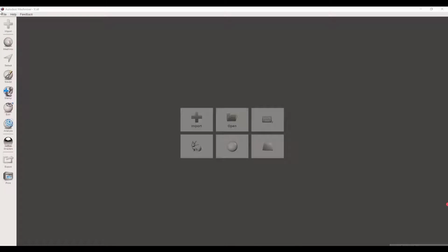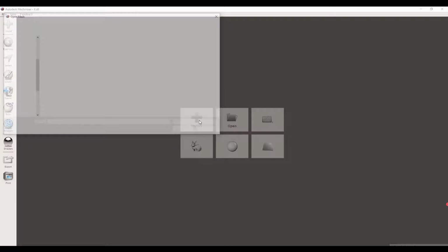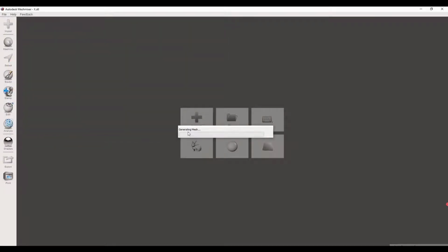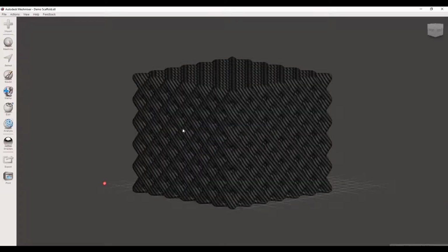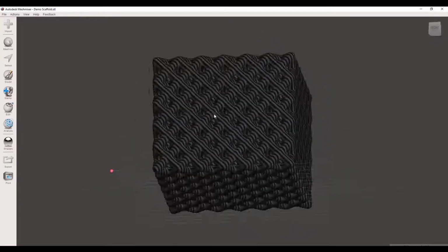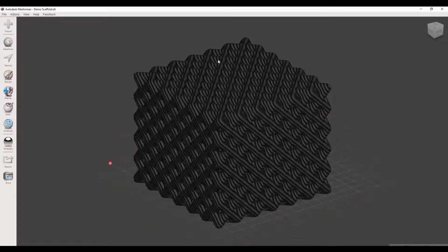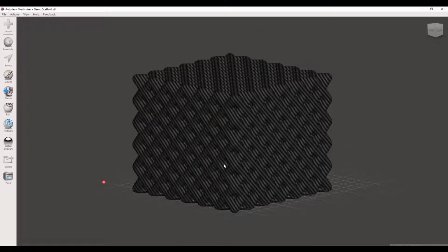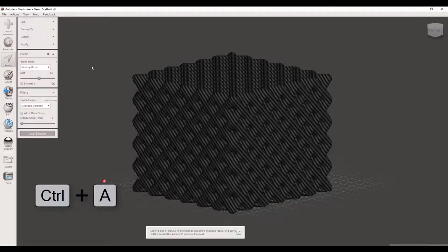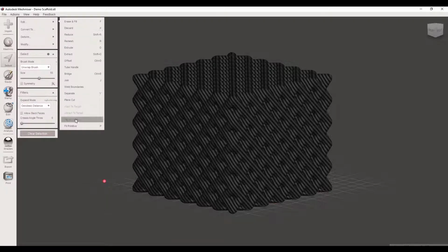Now let's open Meshmixer and import the STL file of the scaffold we just created. This is very important because Meshmixer helps us to fix any errors in the mesh of the scaffold and to make sure that our 3D printer will print the object without any problems. Sometimes, as you see in this case, the scaffold appears completely black because of a problem with the so-called mesh normals. Simply press Ctrl A to select the entire scaffold geometry, then click on Edit and Flip Normals.